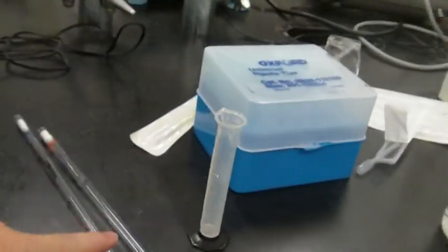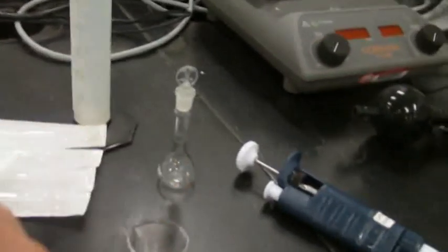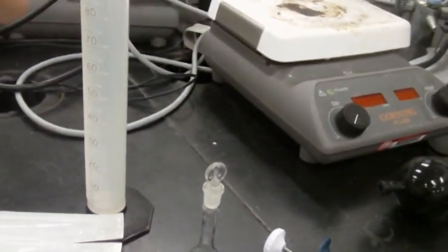All right, so you finished with your third tool for 1 milliliter, correct? I did. Now, you're going to repeat this for 4 milliliters and 10 milliliters, is that right? That is right. And again, we identified previously the tools, but we'll remind ourselves, these are the 3 that you're going to use for 4. And then these 3, this little beaker, volumetric, 10 milliliter volumetric flask, and graduated cylinder for the 10, correct? Correct. All right, so you're going to have another one of these. You can copy and paste that whole thing.